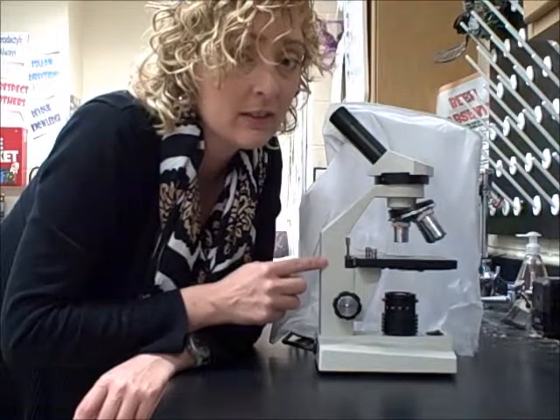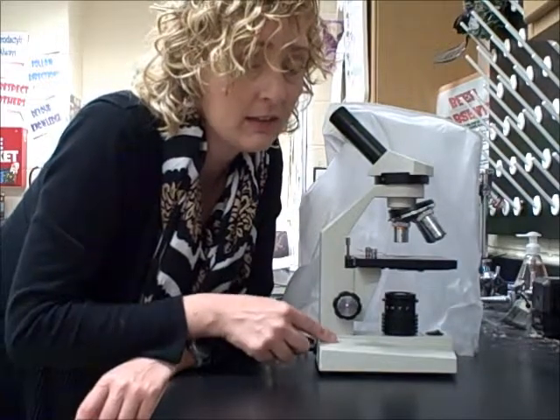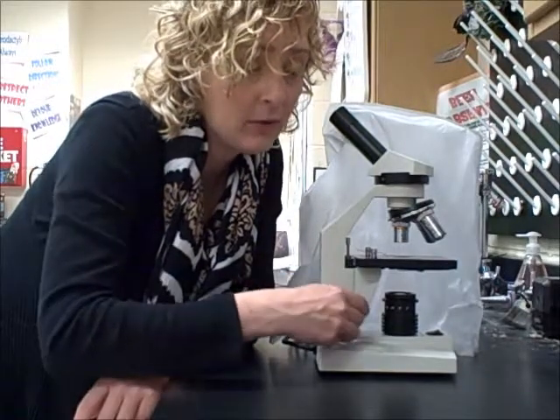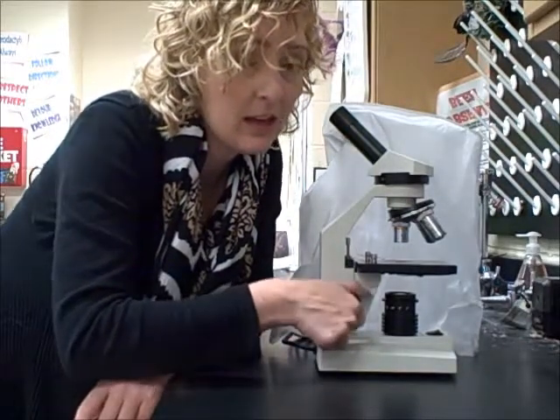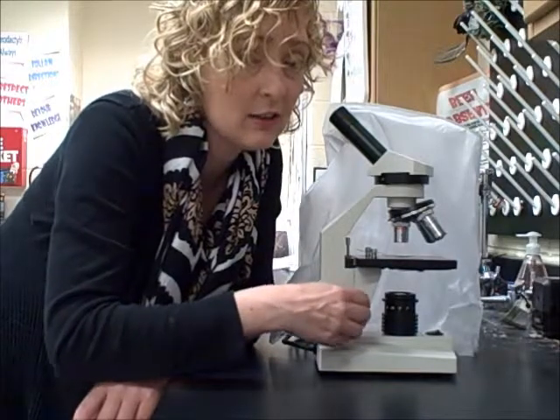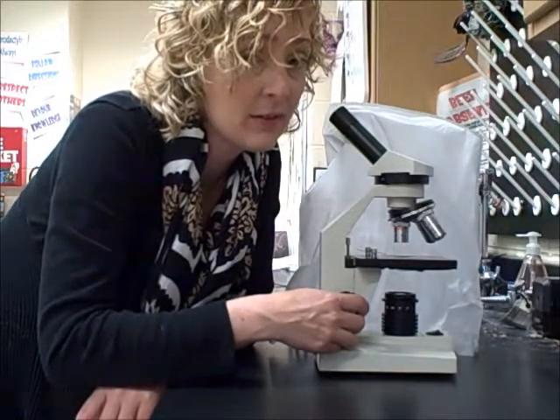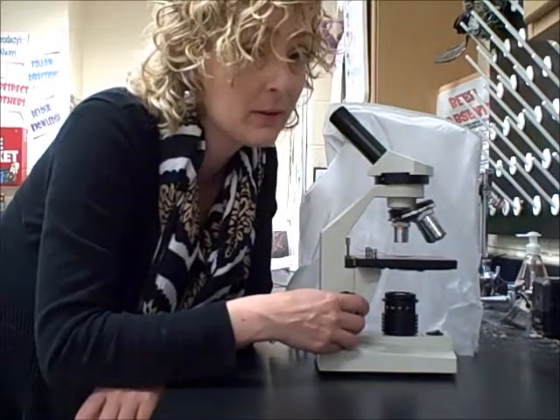The arm is connected to the base. And the coarse adjustment knob moves the stage. And those are the parts of our microscope.